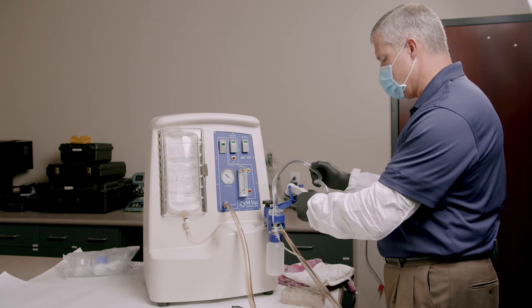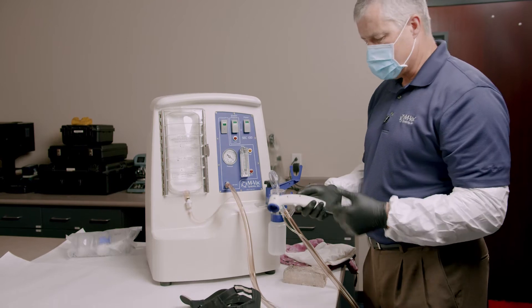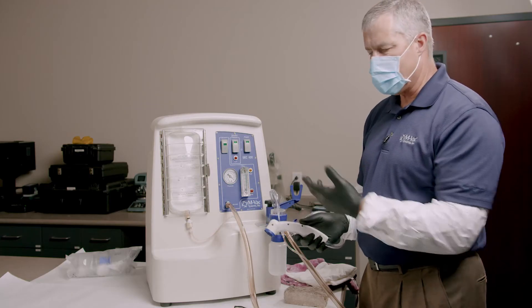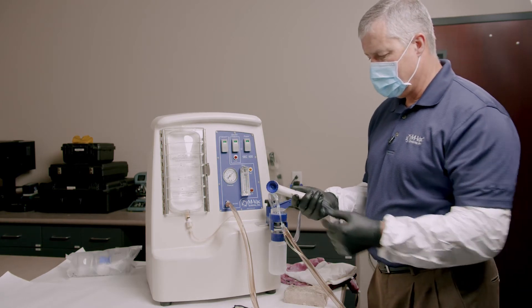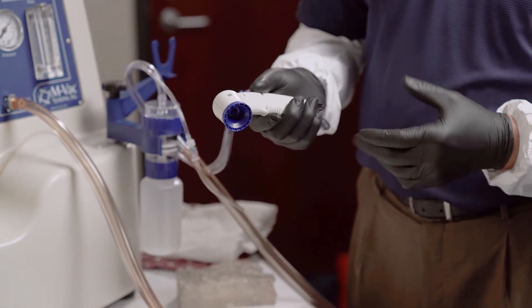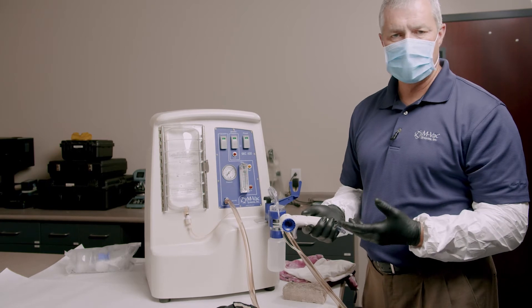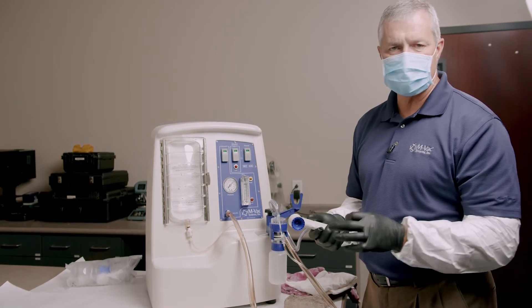What you do is take this sampling head and turn the vacuum on here. The solution is controlled here with this on/off switch, but the vacuum pressure you turn on here. It's got some little nubs on the end to prevent it from sucking down onto the evidence. The reason this system works so well — it can collect 40 to 50 times more than a swab — is because it sprays and vacuums at the same time, just like a carpet cleaner.